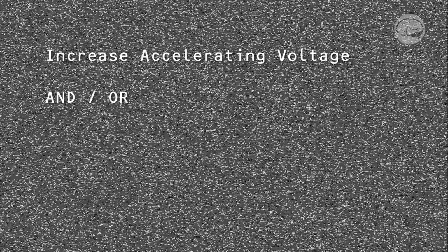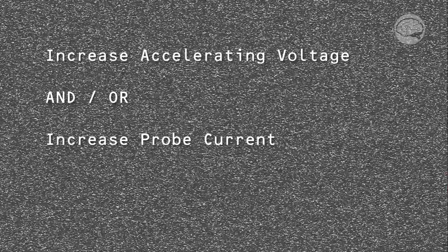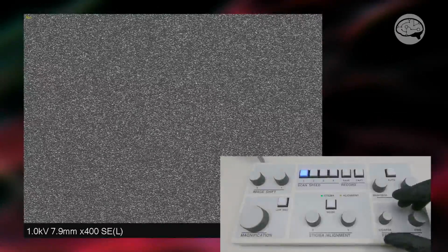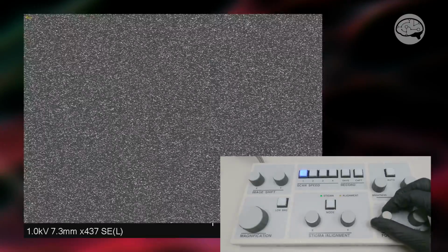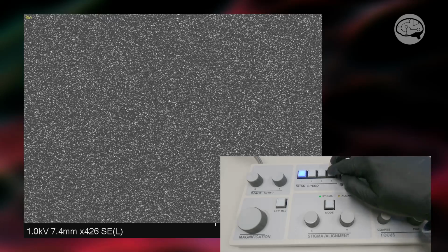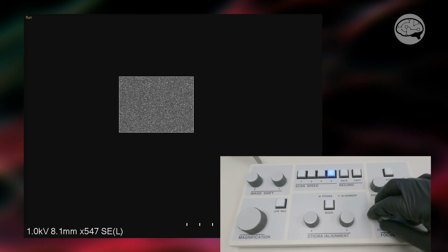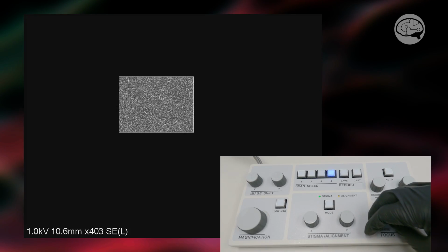And if this is the case, you have two options to fix it. First, you can increase the voltage, or you can increase the current. And you can do that by putting in a larger aperture, increasing the spot size, etc. However, you may not be able to do any of those things. Maybe you have to run the microscope in this low current mode on purpose. Maybe you're trying to get better resolution, or maybe the sample is very beam sensitive.